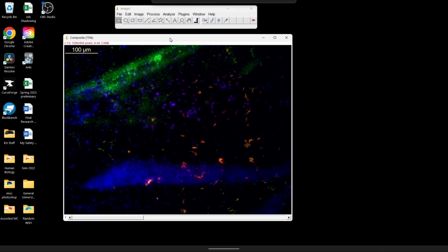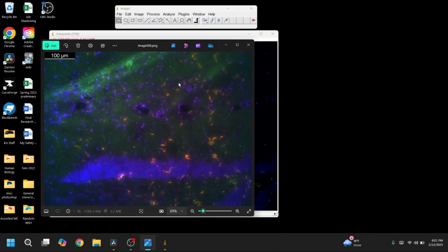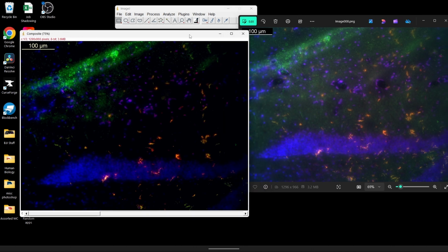So we've got a pretty decent image here. We can see a nice colocalization in that yellow color between the red and the green. We see that the DAPI isn't so overblown that it's overtaking all our other stains. We can see that we still kind of have a little bit of that non-specific green stain, but with such a weak stain, we're probably not going to get much better than this. So especially if we're comparing to what we started with, we have a lot less background this time, and it's a little bit of an easier image to look at.